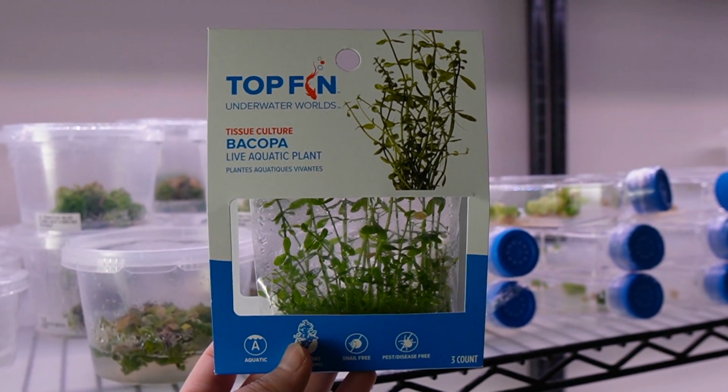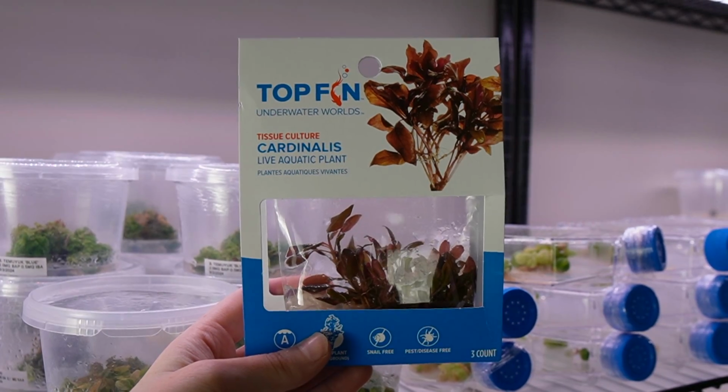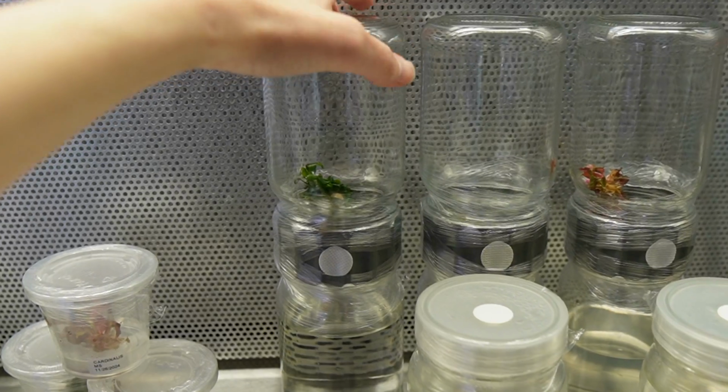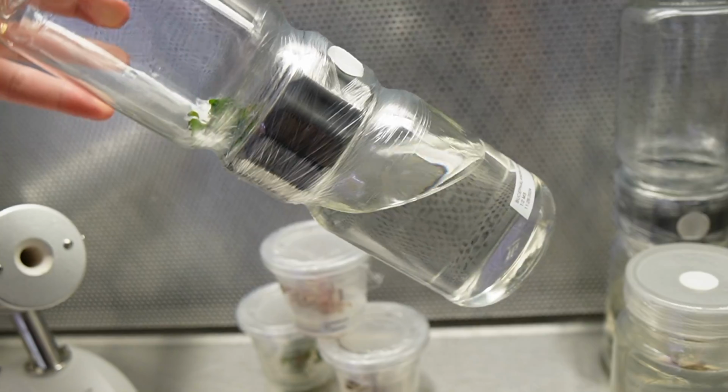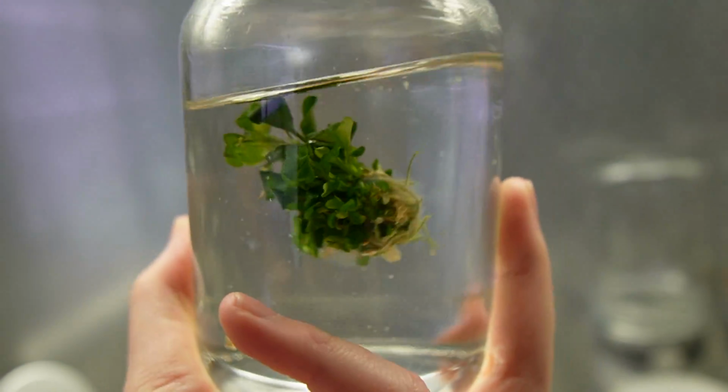I ended up getting 3 cultures. I got a Bacopa culture, a Bucephalandra, and also a cardinalis. To test these plants for contamination to see if they're good candidates for tissue culture or not, I decided to transfer them into some BioCouplers.